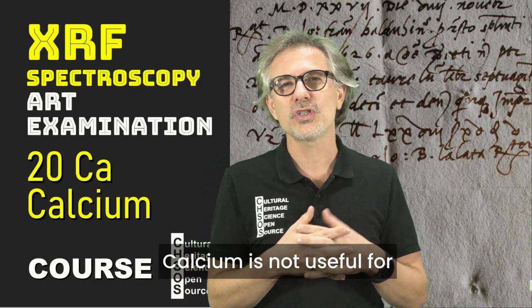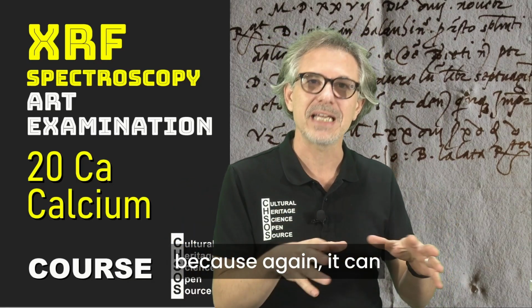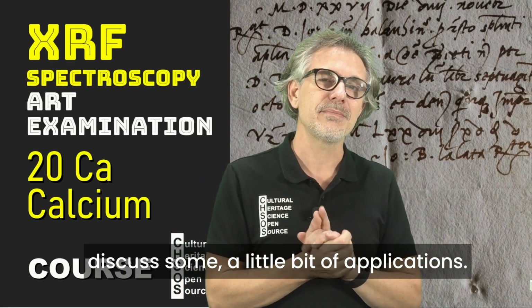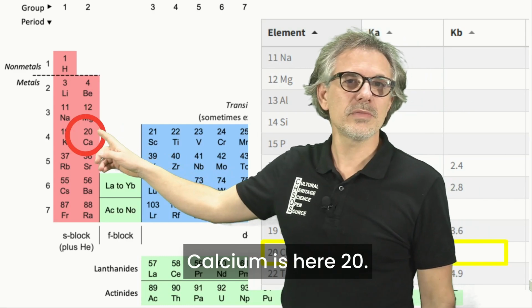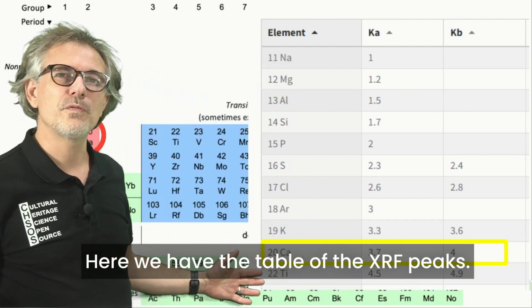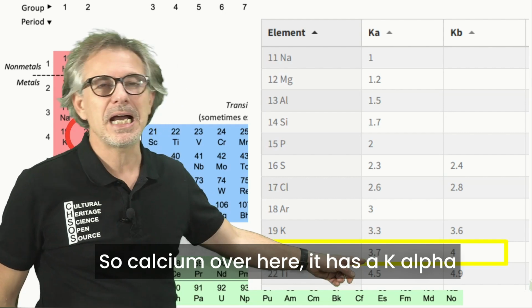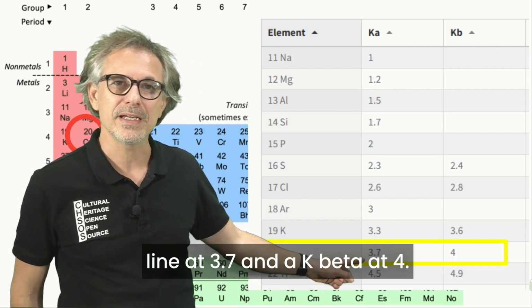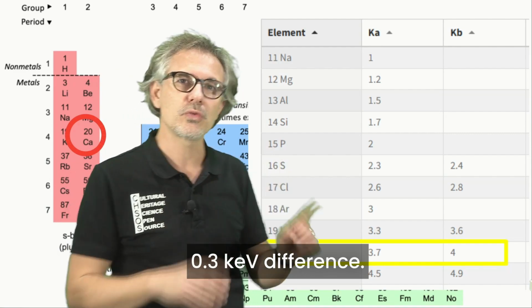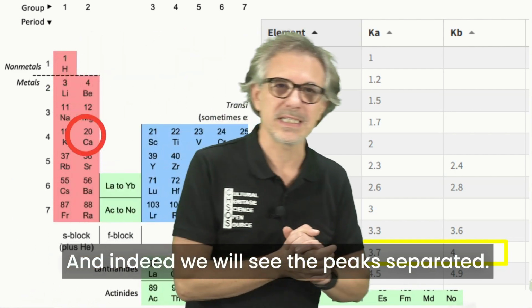Calcium is not useful for the identification of the pigments because again it can be due to the ground and to the filler. In this lesson I will just discuss a little bit of application. Calcium is element 20. Here we have the table of the XRF peaks. Calcium has a K alpha line at 3.7 and a K beta at 4. They are far apart, a 0.3 keV difference, and indeed we will see the peaks separated.